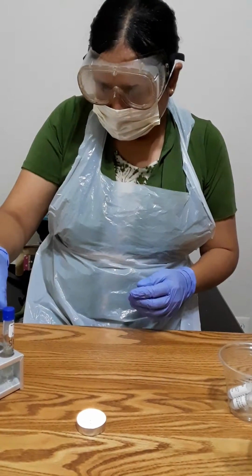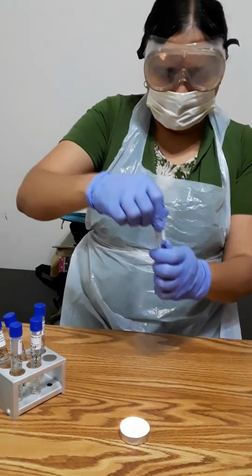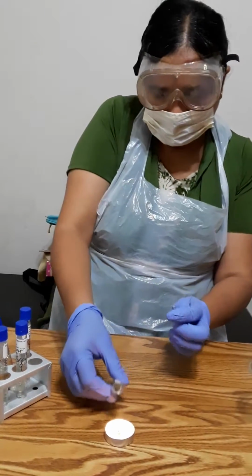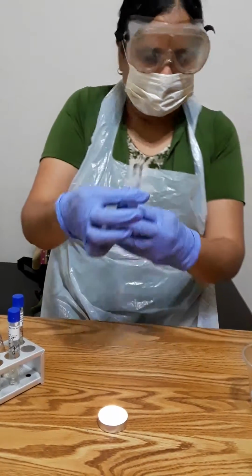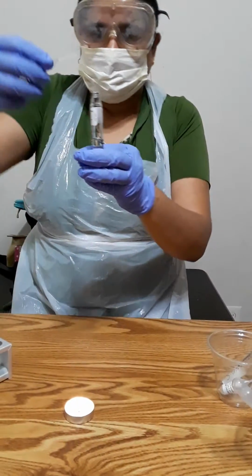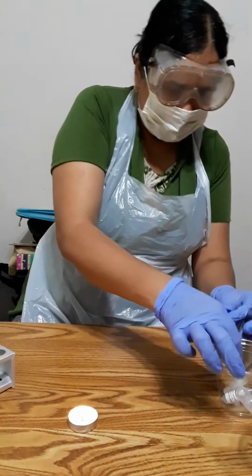Keep it here. And in the same way I'm going to do it for S. epidermidis. I'm going to put 1 drop of HCl here. Okay.